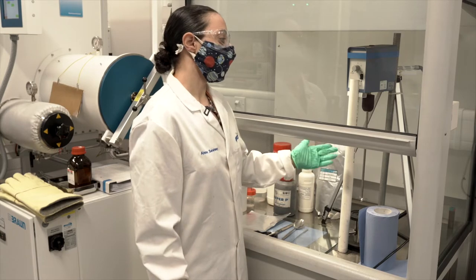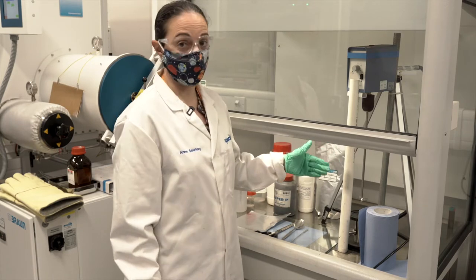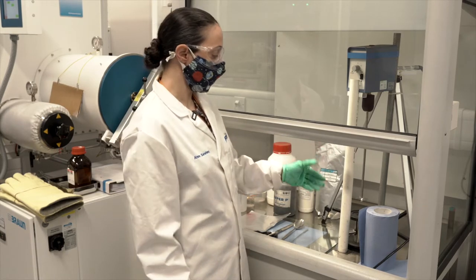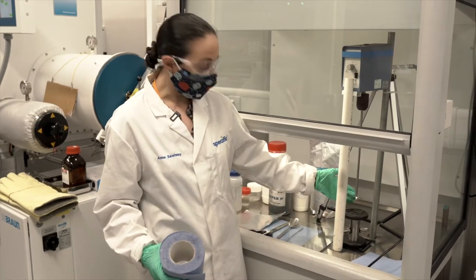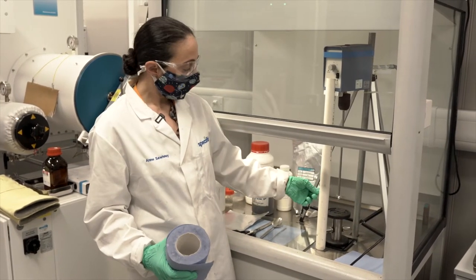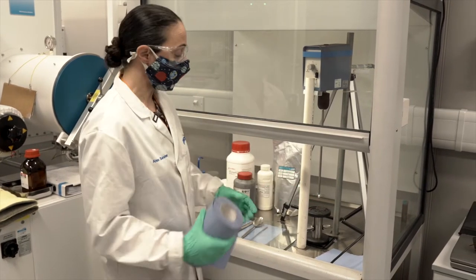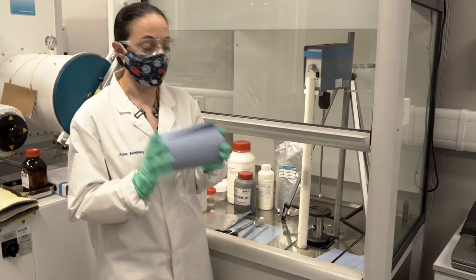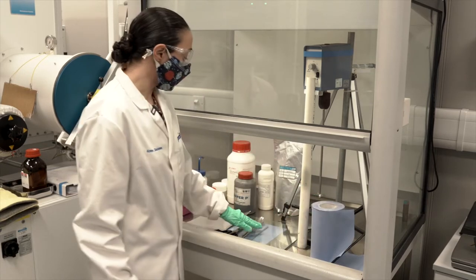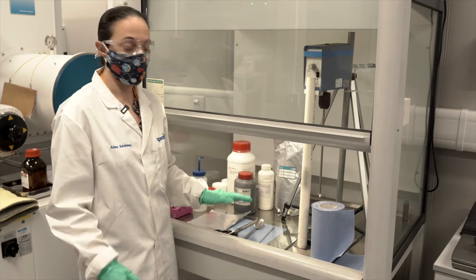I've got a generic overhead stirrer from a laboratory supplier. On the end, a blade mixing head with a diameter of 50 millimeters. I'll use a lot of blue roll and some other generic laboratory tools for cleanup.